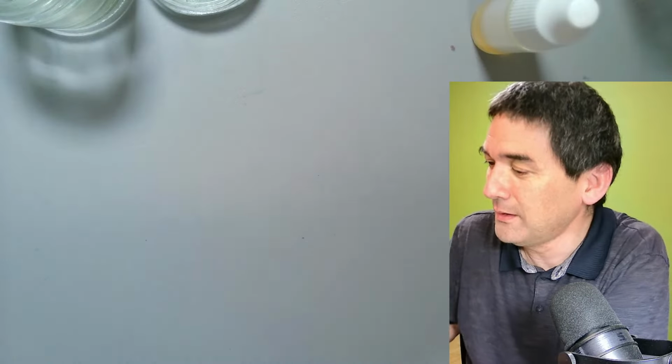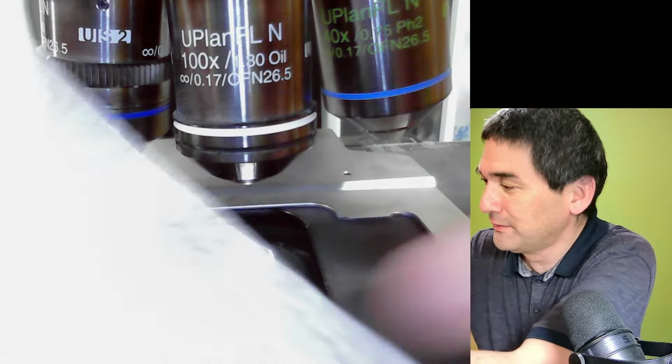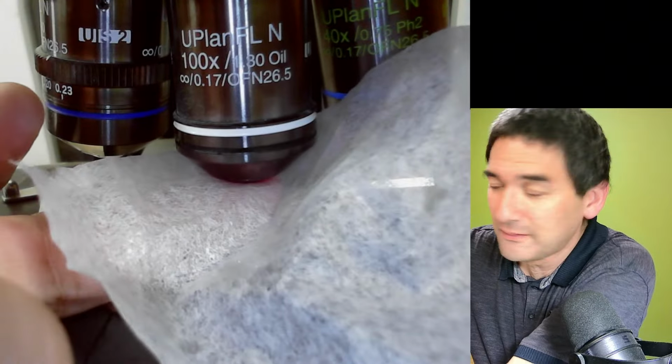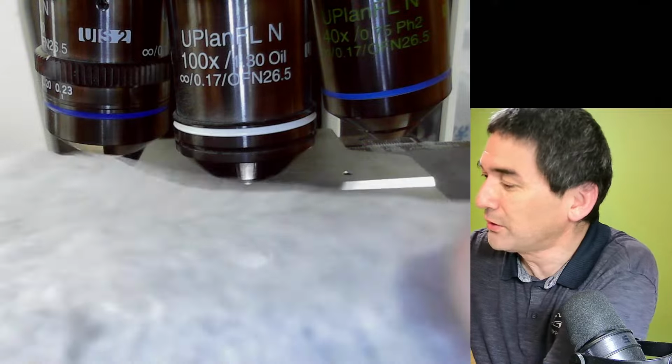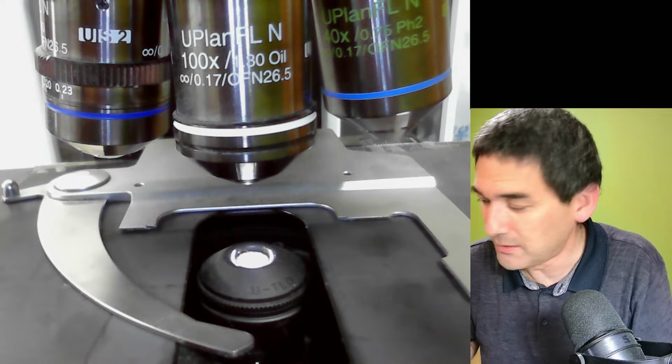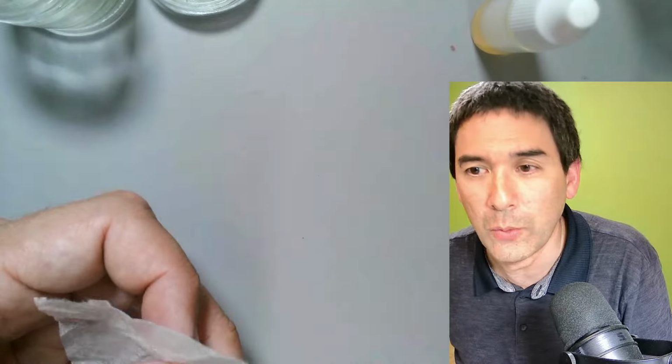And again, stage view, and basically, if I don't see anything, then I say it's fine. Okay, so that's basically what I'm doing. And now I'm going to go back here.